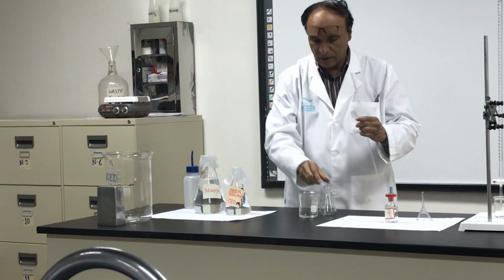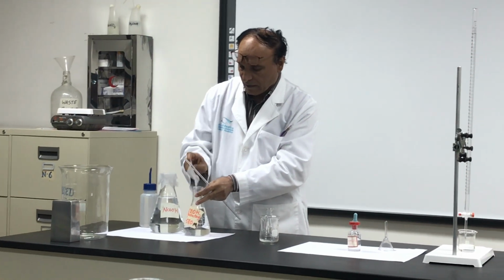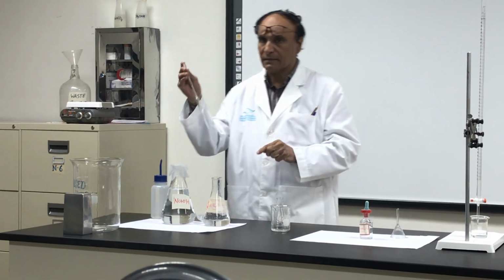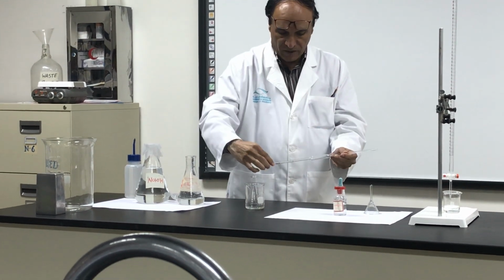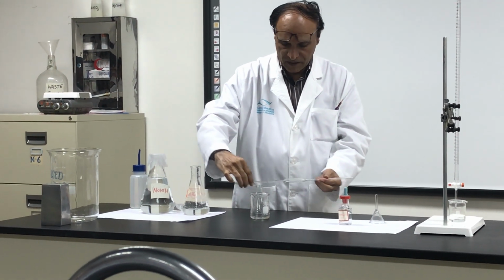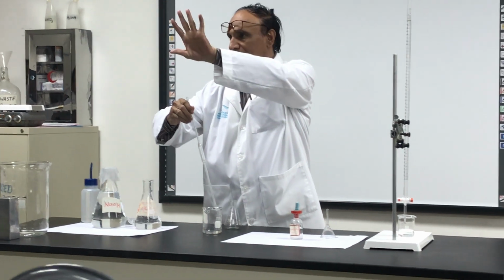Then go there along with this, open this paraffin film, and take a little bit of this and wash it. Wash it because there was water. Wash it and then put it there. You can put it over here or in the sink, wherever you like.